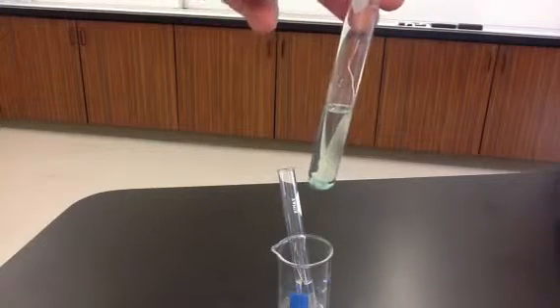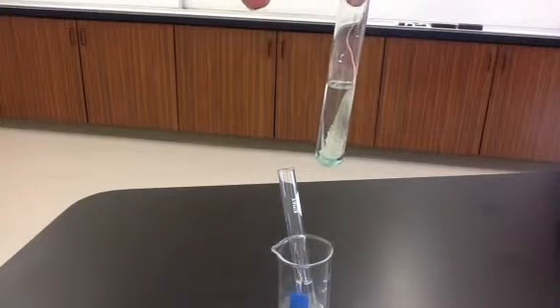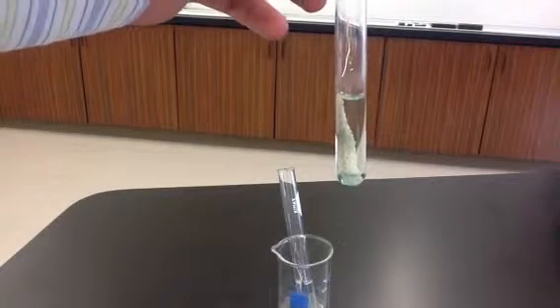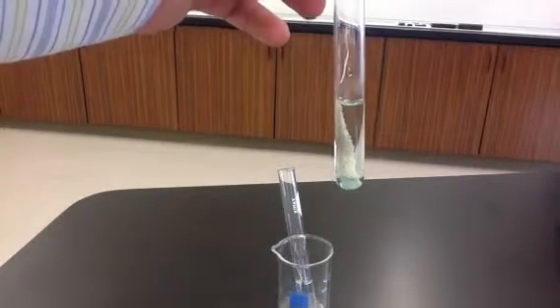That blue color in the solution is because copper ions are starting to go into the solution. And copper, when it's in solution, the ions are a blue color. So this is silver coming out of the solution and copper going into the solution. This is a single replacement reaction.